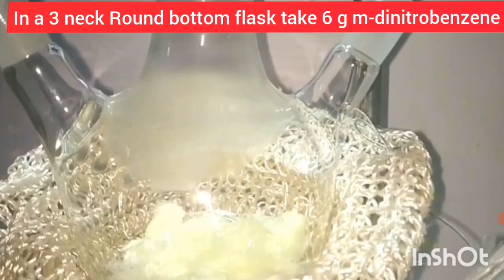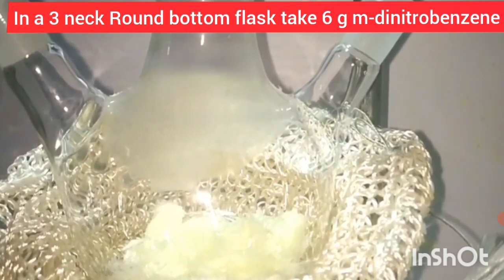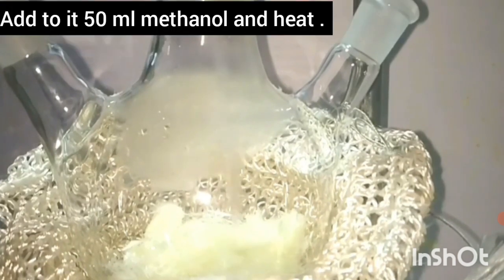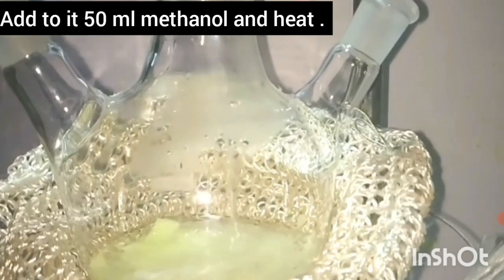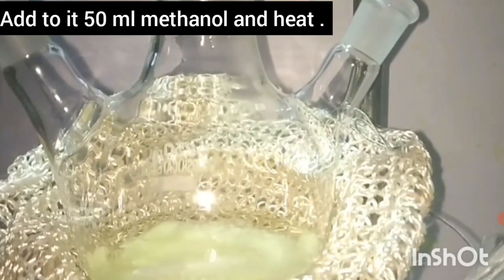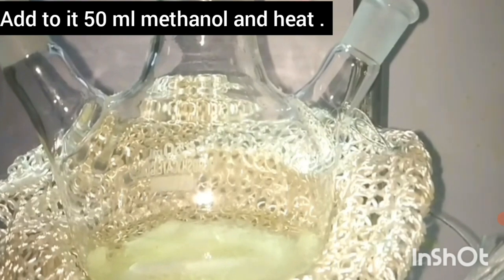Now in a 3-necked round-bottom flask, take 6 grams of M-dinitrobenzene as the reactant. To this, add 50 ml of methanol as a solvent. Stir the reaction mixture so that M-dinitrobenzene will dissolve.